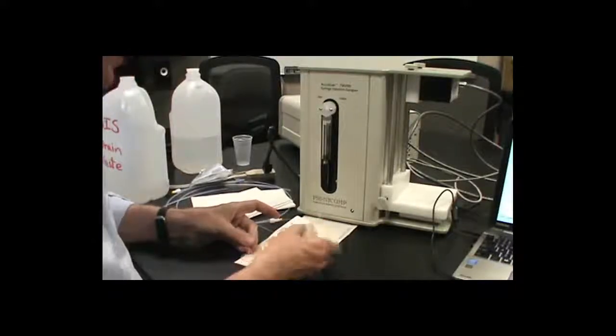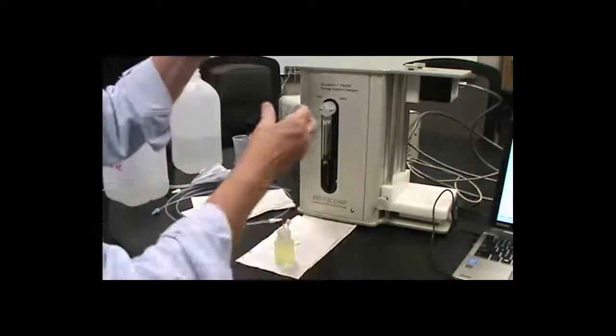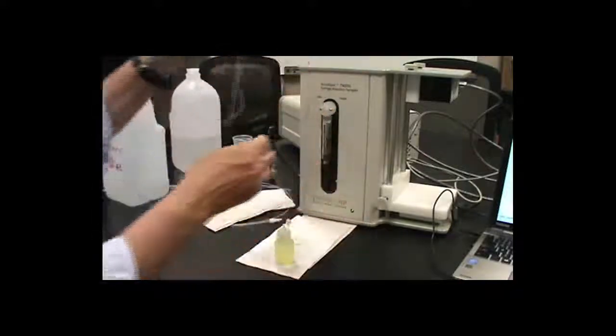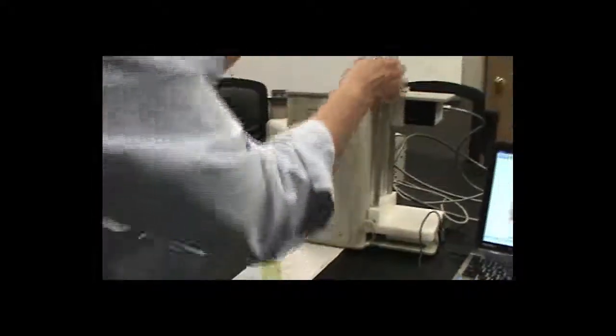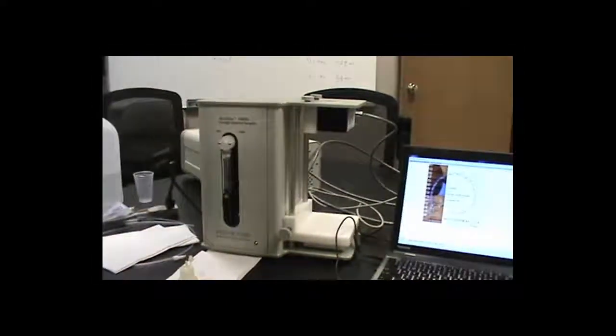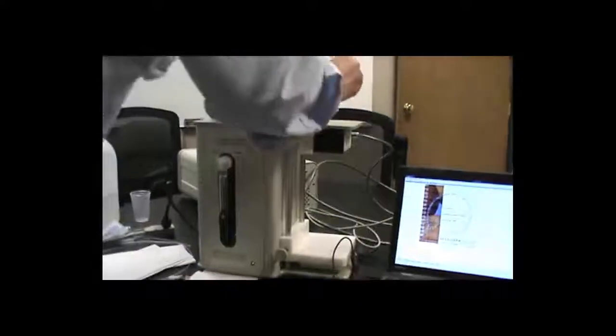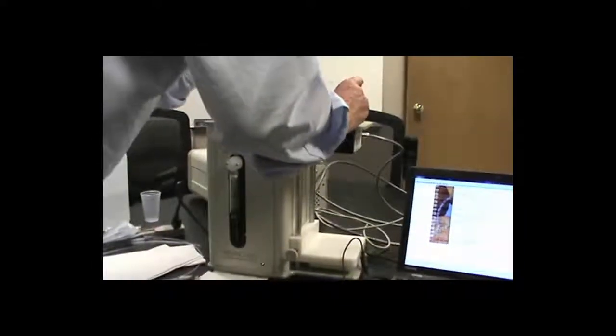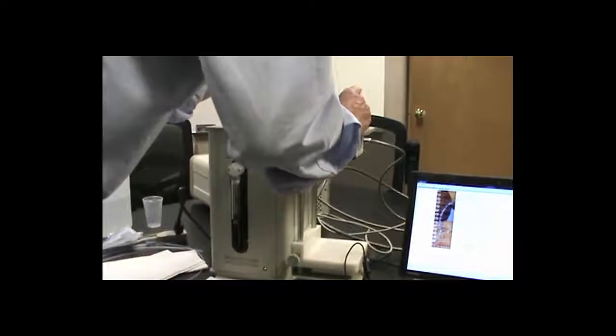Get it nice and wet. Then what I'm going to do is draw this down through the sensor. I take this end, which is closer to the thicker part of the floss, and feed that down through the sensor.